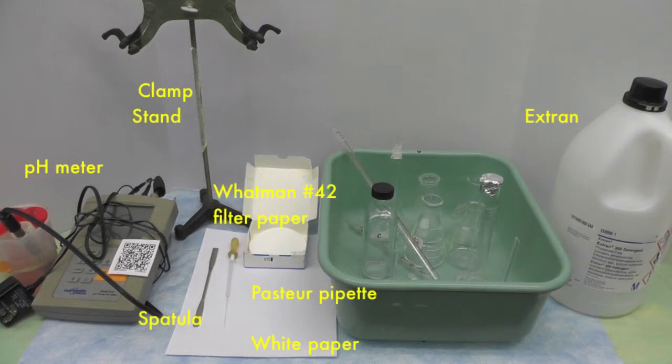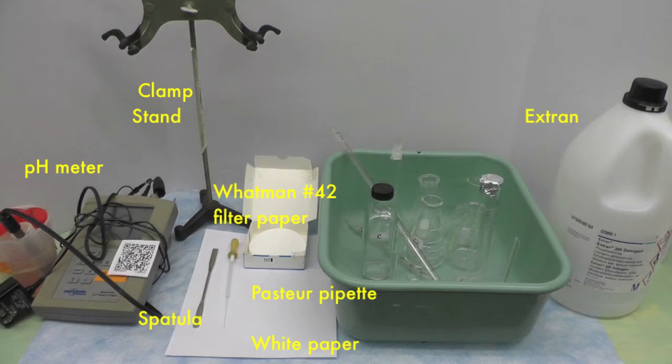This video will demonstrate the back titration method for calcium and magnesium determination. Here is the equipment you will need.